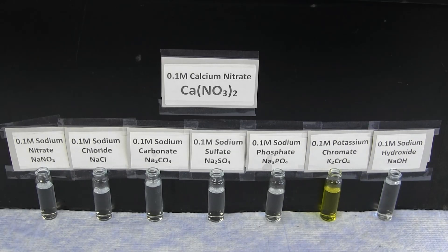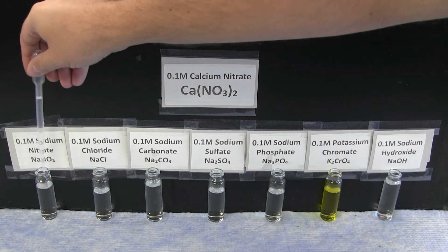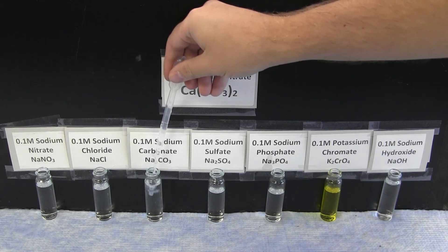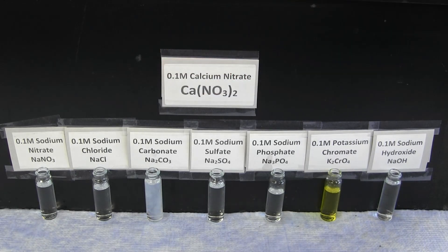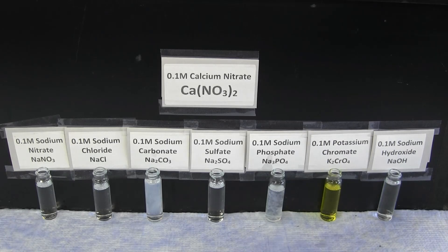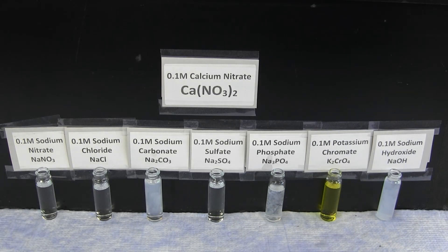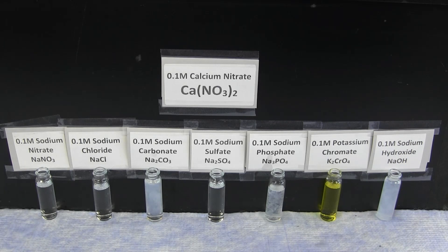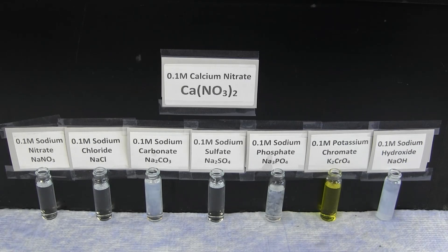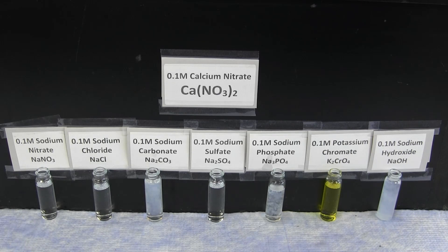The next reaction set to observe are the reactions of the calcium ion. Overall, the calcium ion reacts to form a white precipitate with sodium carbonate, sodium phosphate, and sodium hydroxide. There is no reaction with sodium nitrate, sodium chloride, sodium sulfate, or potassium chromate.